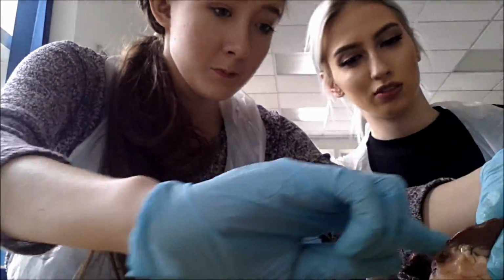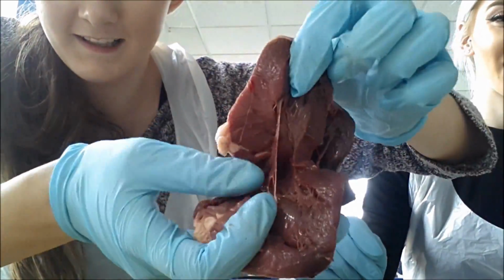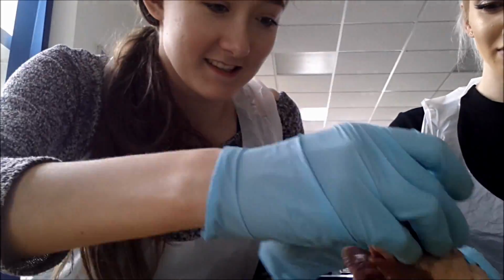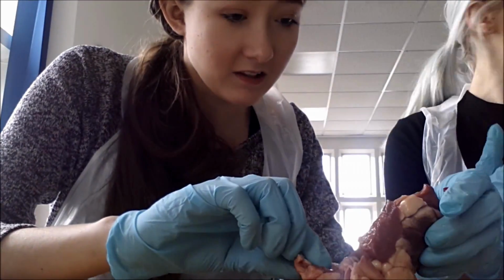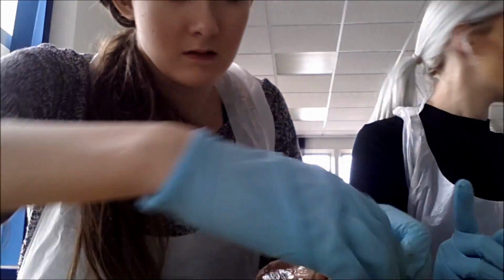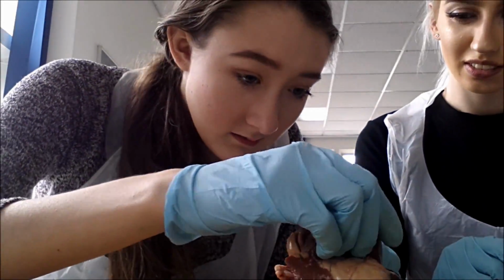The tendinous cords, or the heartstrings, attach each ventricle to its valve. These hold the valves firmly. As the blood begins to flow back, the valve is forced shut, and this prevents any further backflow. So valves are basically like swing doors that only open one way. This prevents the blood from going backwards and works against gravity.